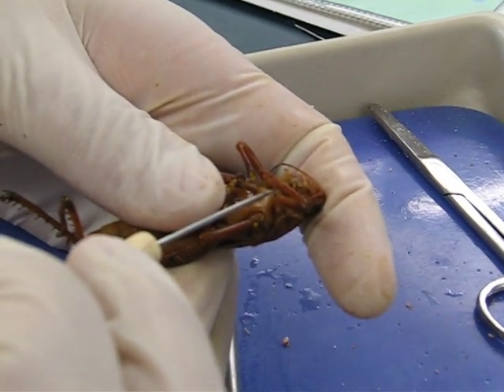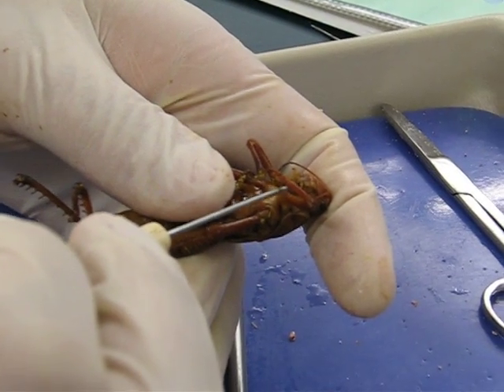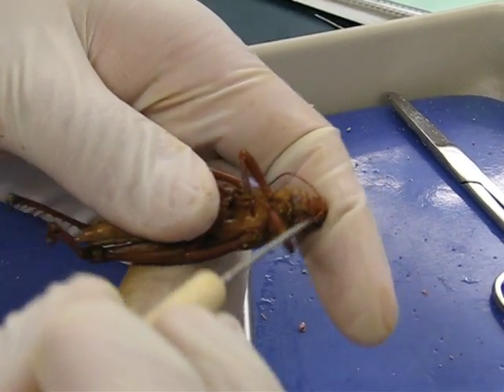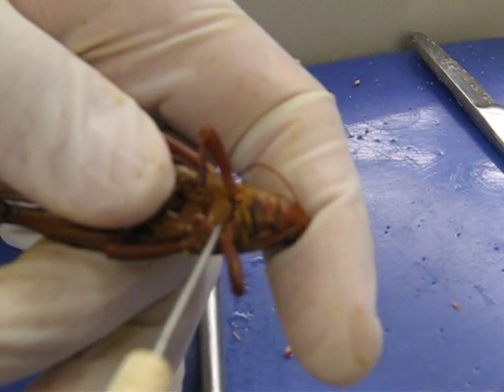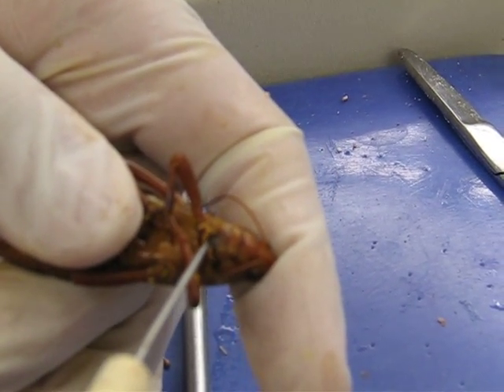Labium. Labium. Lower lip with palp. The mandible is inside it all.